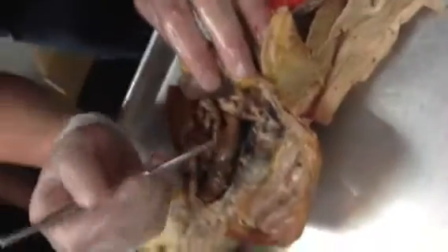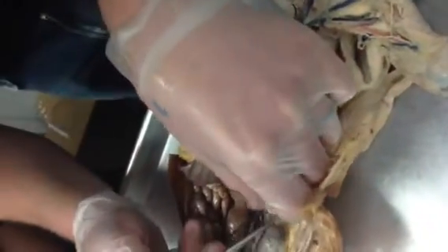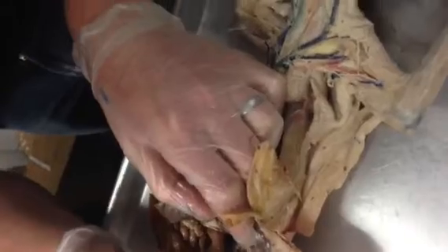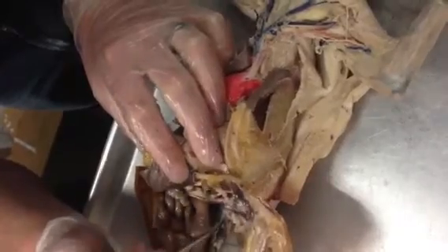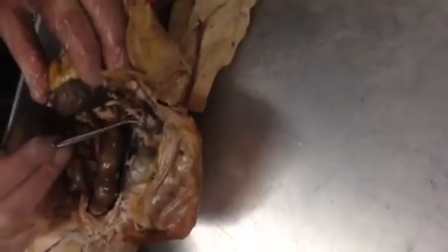So really not well identified right here is the adrenal gland, and so let's try and find that. So the adrenal gland, remember, is medial and superior to the kidneys in cats. What's that? Looks like a bean. Yeah, it looks like a little tiny bean. Usually it's not that hard to find. Isn't it that little brown one? This guy here? Or maybe not. No. This thing? Yeah. It could be.